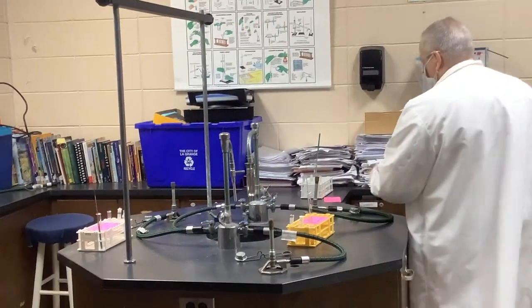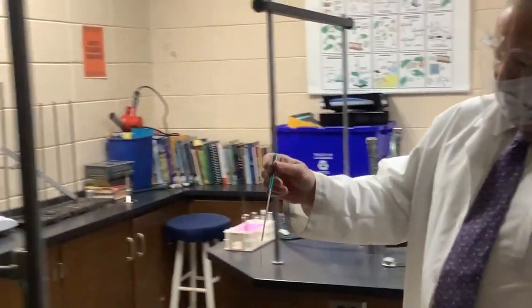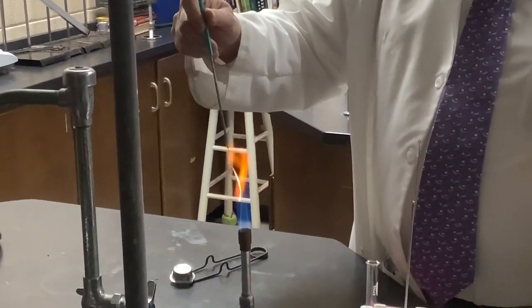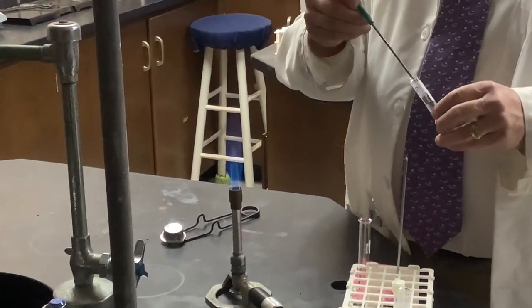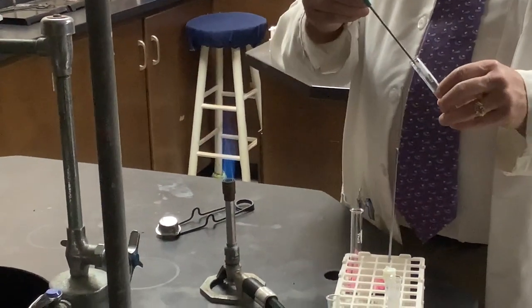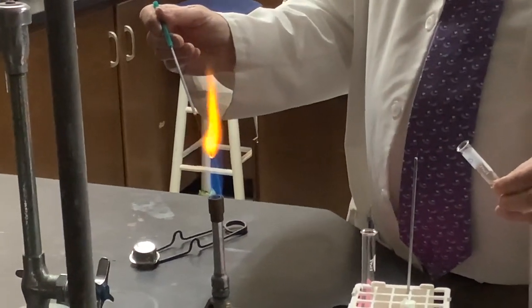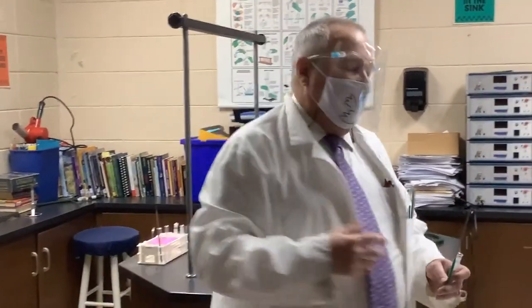Our final one today for the flame test is sodium chloride. Sodium again is not so dramatic because like the wire itself, it gives an orange flame test. So you're going to see orange, orangish yellow, and then back to orange. You're going to see one color of orange and then quickly there, and then back to the other color of orange. But we will record these and write these down in the data and discussion aspects of our lab.